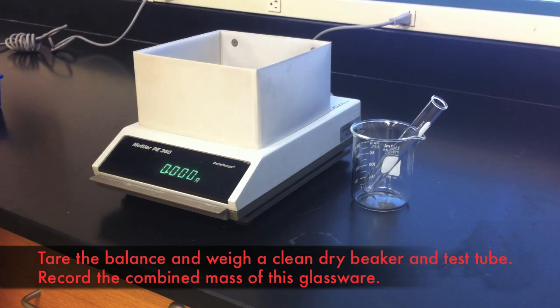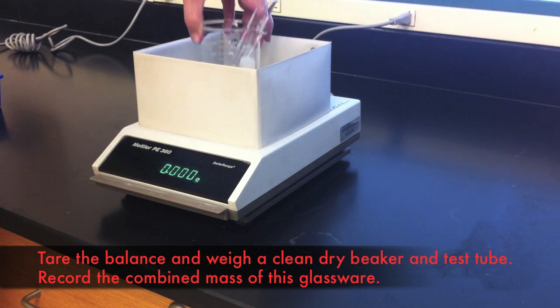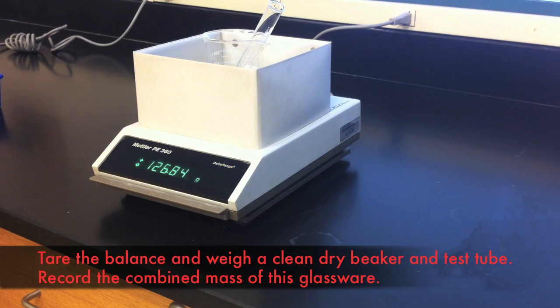You will start this experiment by taring the balance and weighing a clean and dry beaker and test tube. Record the mass in your lab notebook.